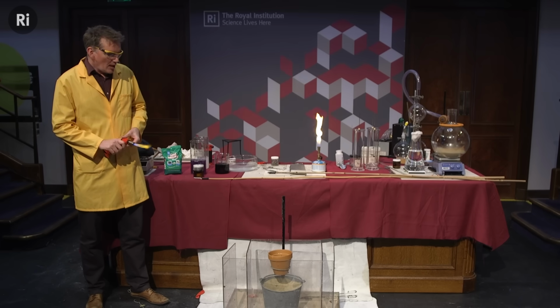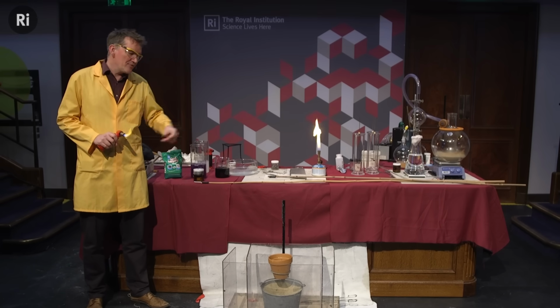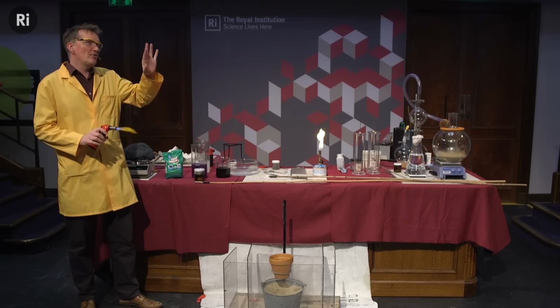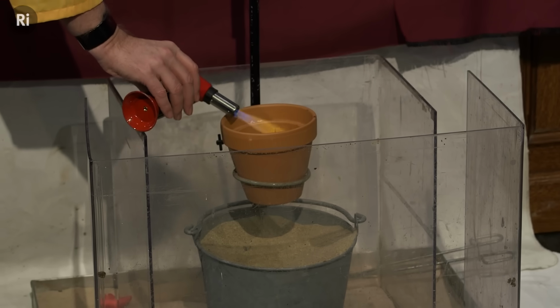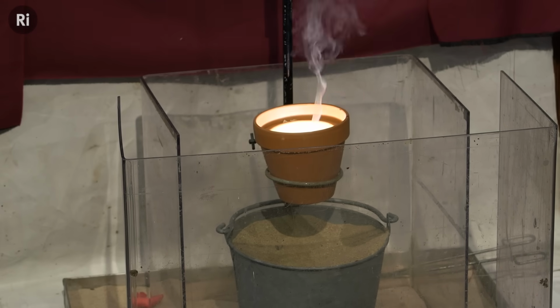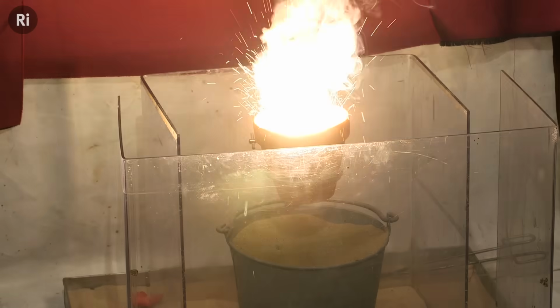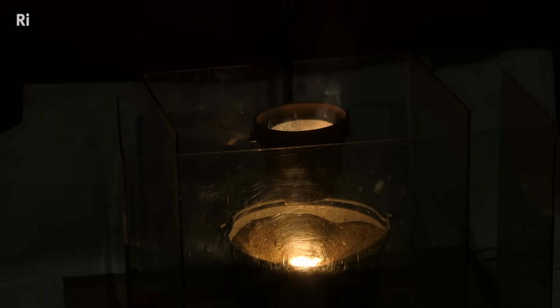So sticking out of this, I've got a little piece of magnesium ribbon. So initially, I'm going to light that, and that will then get the reaction started. So you'll see a white flame, the bright white light from the magnesium, and some of the magnesium oxide smoke. So let's just start the reaction. There we are. So that's the magnesium going. That's the bright light of the magnesium forming the smoke, magnesium oxide. That eventually will get down to the mix and start the proper reaction, there it is. Okay, that's good. And if you put the lights down for a second, please.